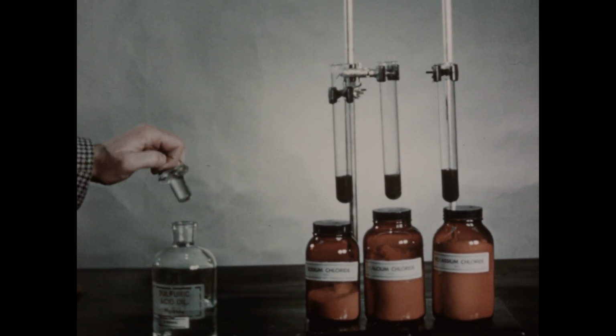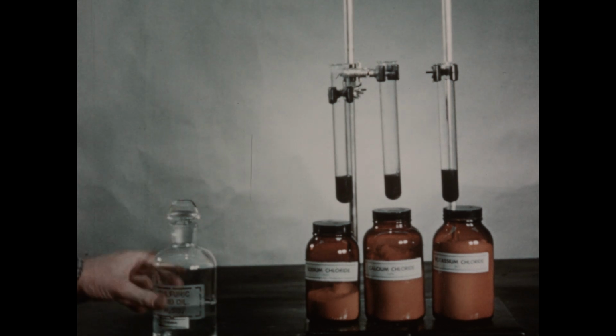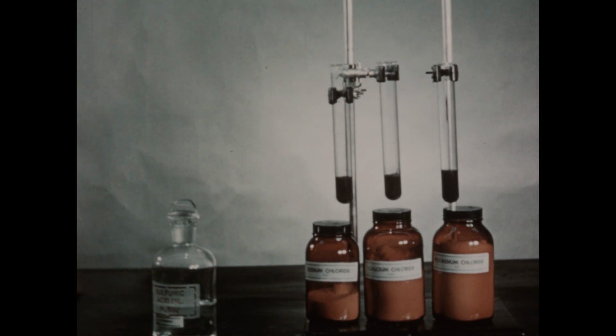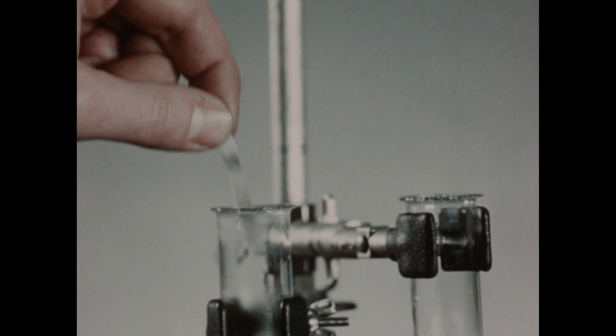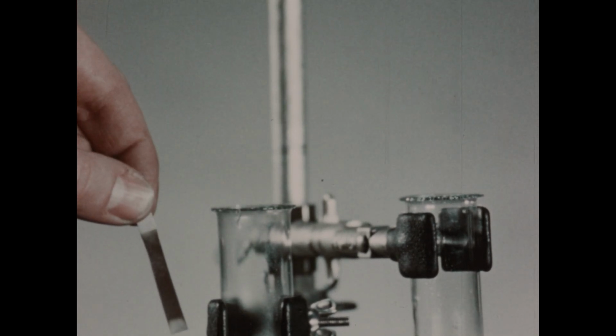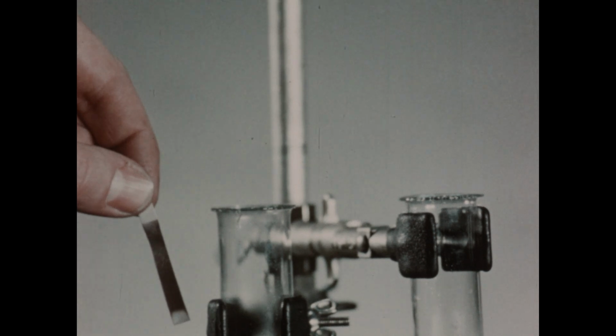Now we'll warm each tube, wait a few minutes, and then test the gas in each tube for the presence of chlorine. The contents of each tube have been heated for a few moments, and a reaction appears to be taking place in each. First, we'll test the tube containing the mixture of sodium chloride, manganese dioxide, and sulfuric acid with starch iodide paper. A positive test for the presence of chlorine is obtained.